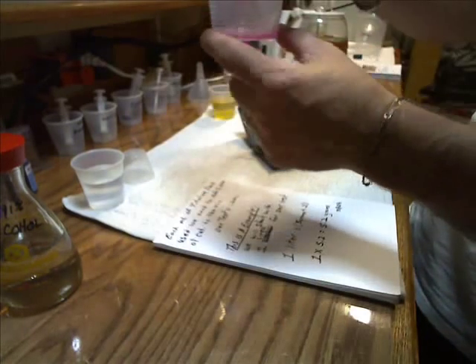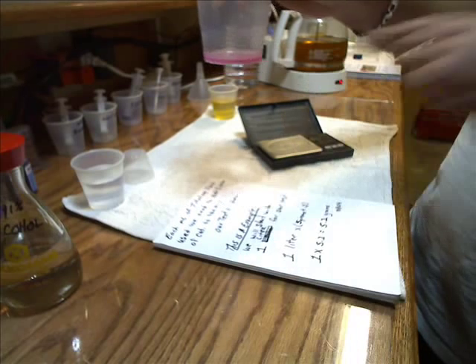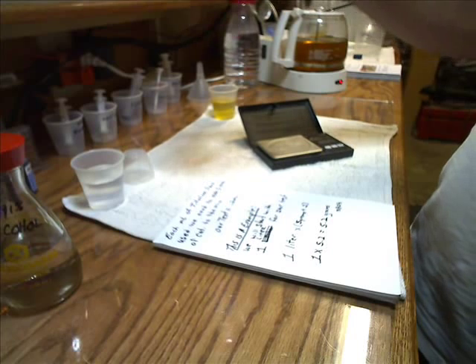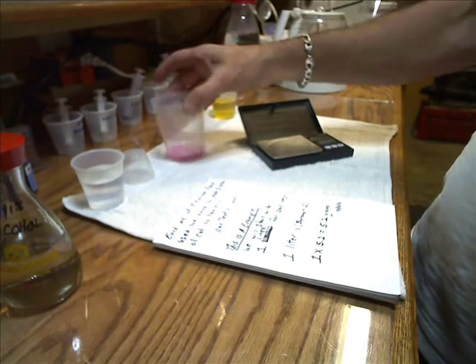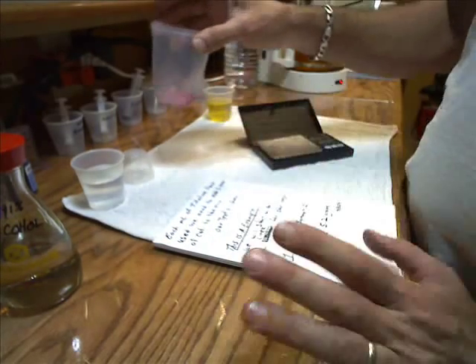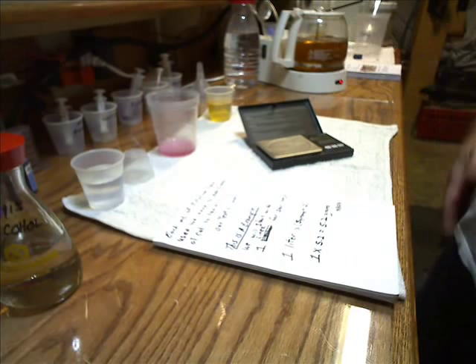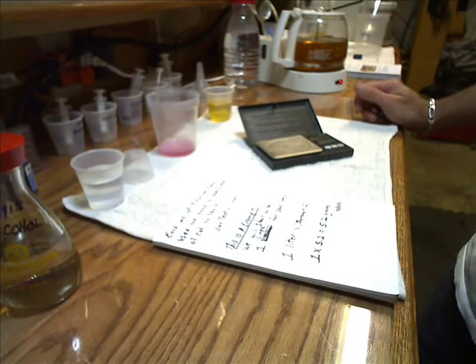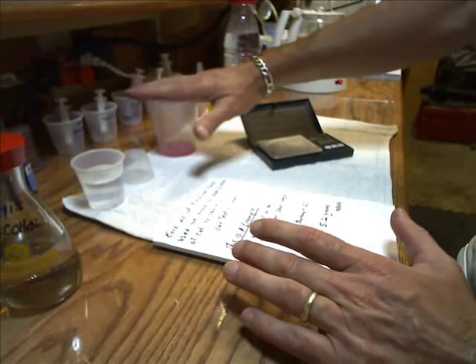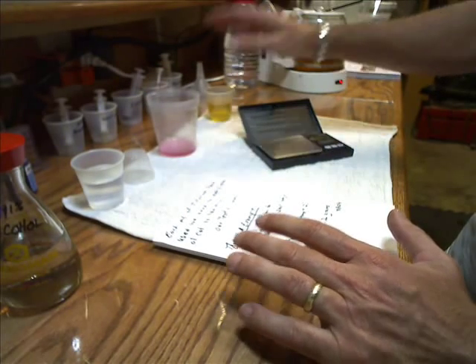What we have in here is 10 milliliters of isopropyl alcohol and one milliliter of the oil. I know before I told you it was 20 milliliters — it's only 10 milliliters. 20 milliliters will work, but I did the test three more times just to make sure my numbers were correct. It still came out the same. I went back to my notes and checked — it is only 10 milliliters of isopropyl alcohol and one milliliter of used oil. Everything else is the same.